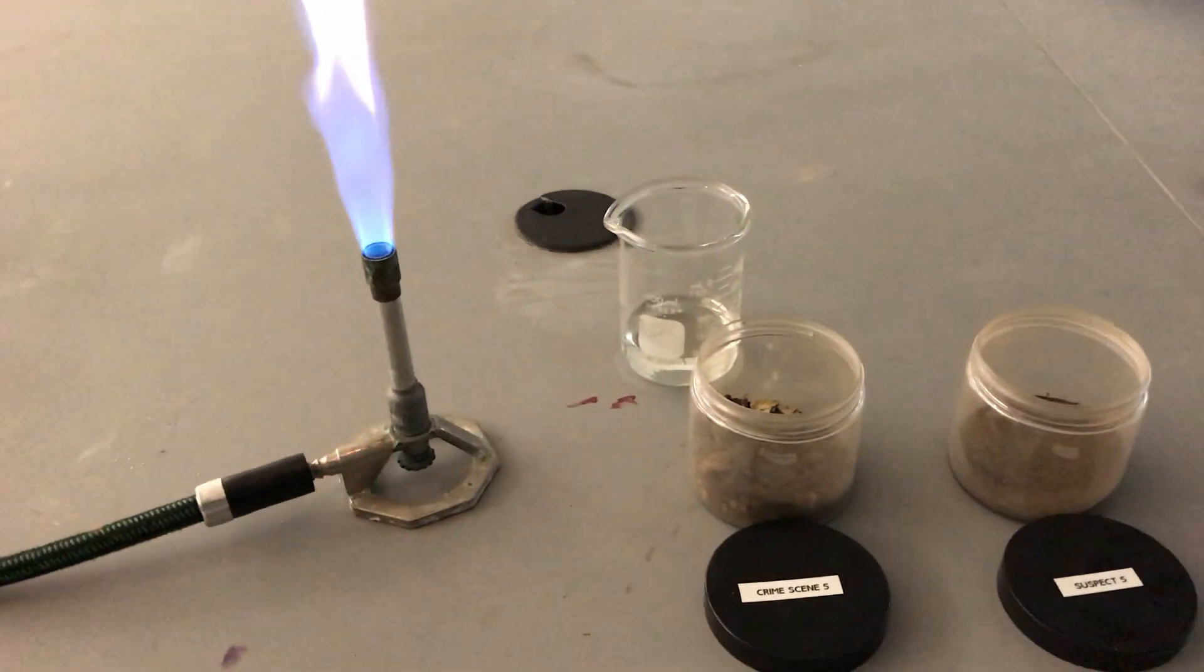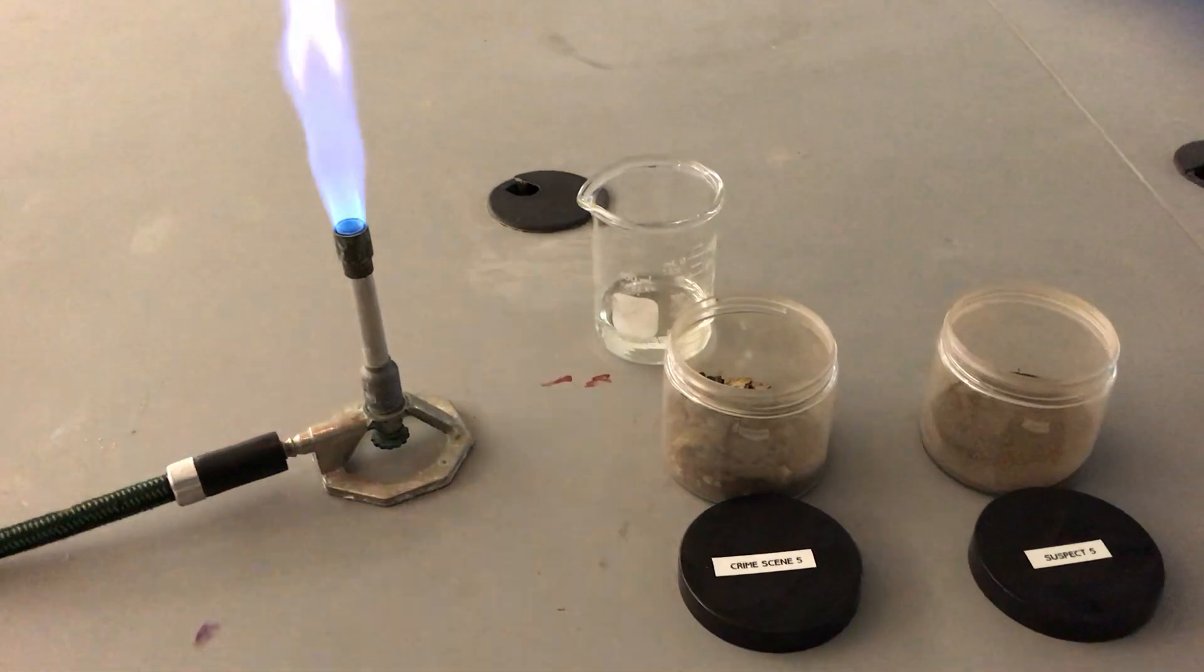Alright ladies and gents, we're now about to subject our two soil samples to the flame test.